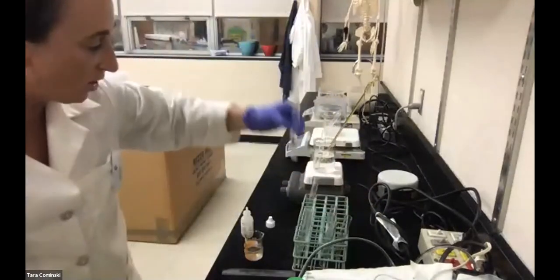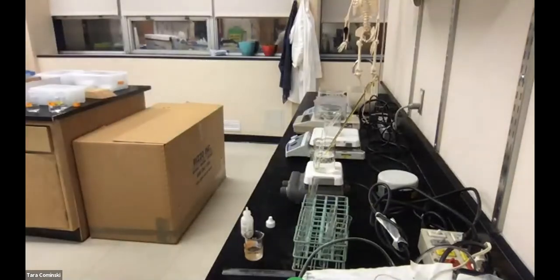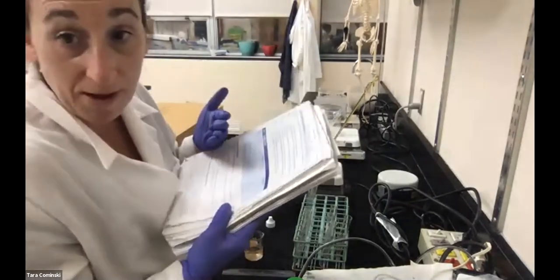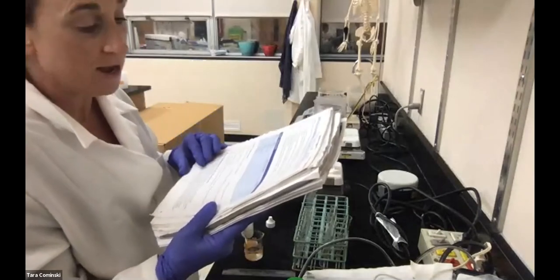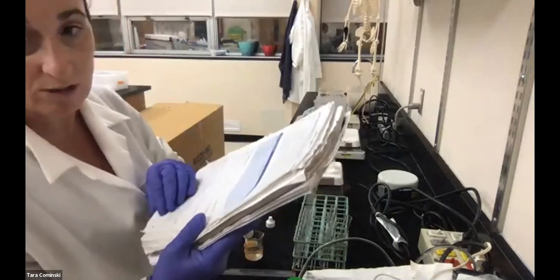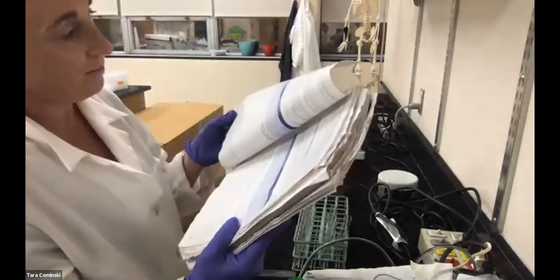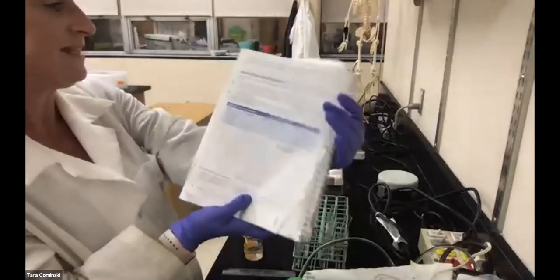Okay, so that concludes that first experiment. Now we move on. Again, that's on page 59. We're completing that table. It asks you about the bubble column height, which we measured. I told you what that was for each one, tube 1, 2, and 3, and an explanation. I kind of talked about that. And then we're answering those questions underneath. Now we're going to move on to the effect of temperature on enzyme activity. The bottom of page 59, but the actual experiment is on page 60.